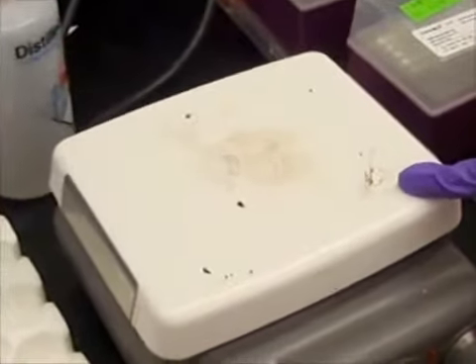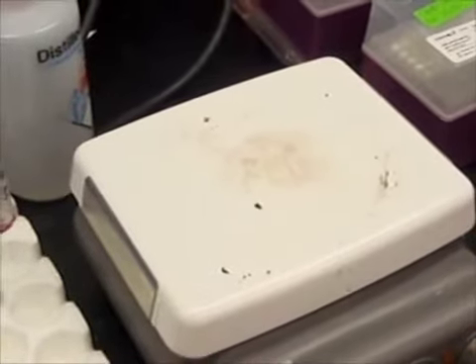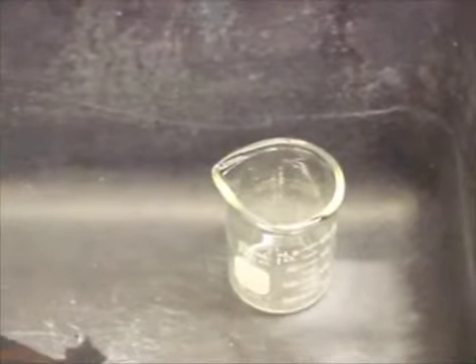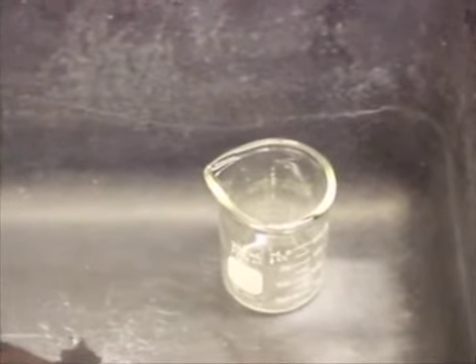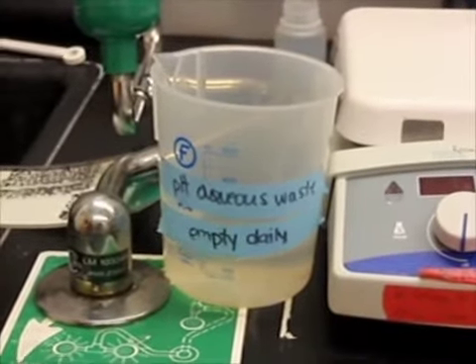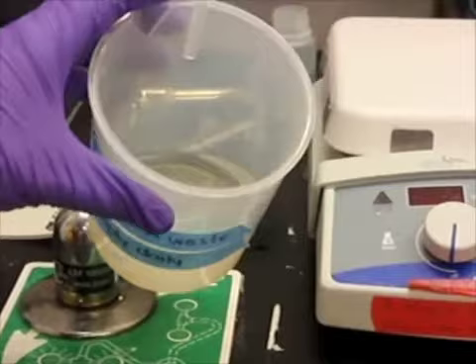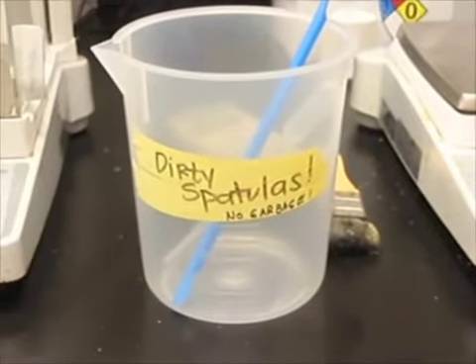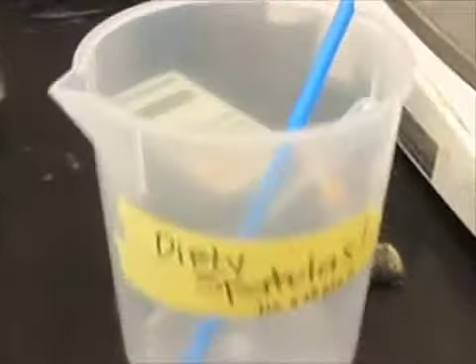Cleaning up after yourself should be straightforward. And yet here we have a sink bearing a clear message of what not to do. A message that seems to have been ignored. Who knows what might grow in a container of waste left here overnight? This empty daily waste container's not so empty this morning. And this bucket, used for collecting spatulas, has things in it that I'm pretty sure aren't spatulas.